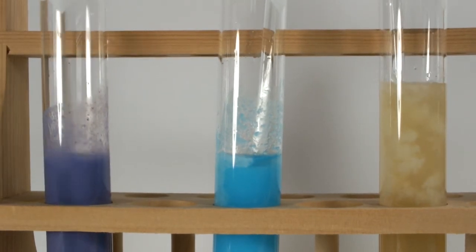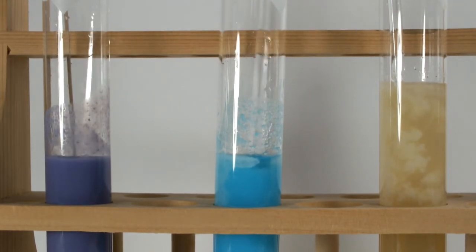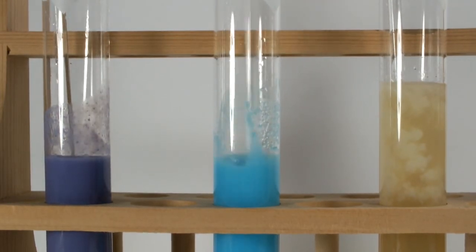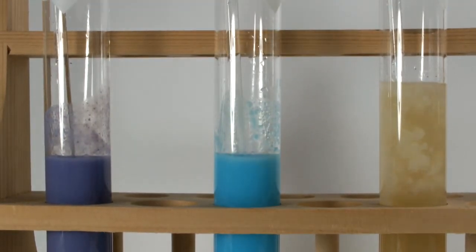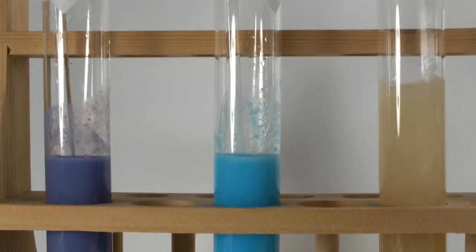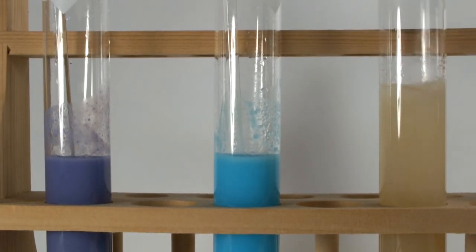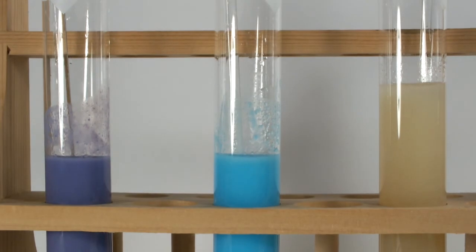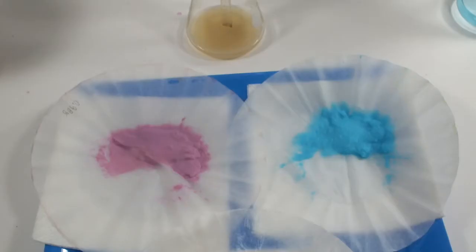As I said before, things get a little more complicated when the cations are not in the plus 1 oxidation state, and everything gets more complicated when you start throwing transition metals into the mix. As luck would have it, none of these three cations form acidic phosphates. Nevertheless, I collected the solids.